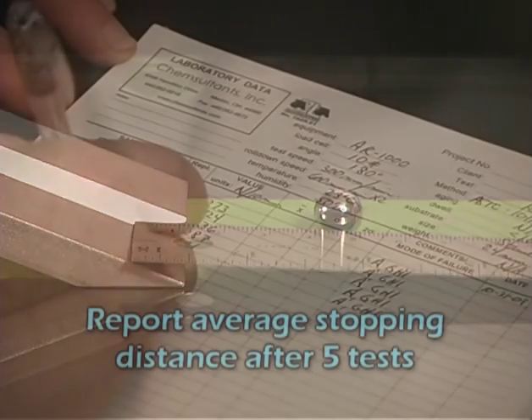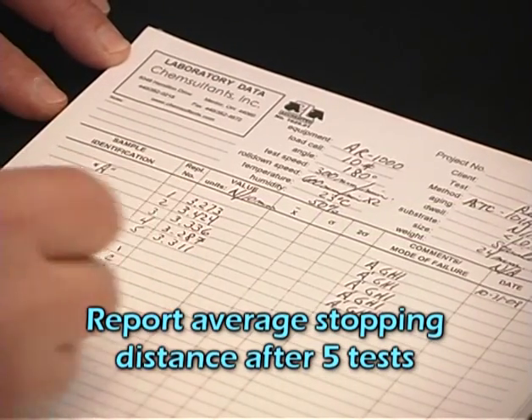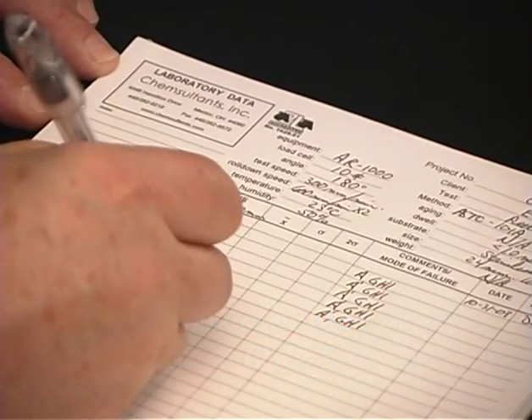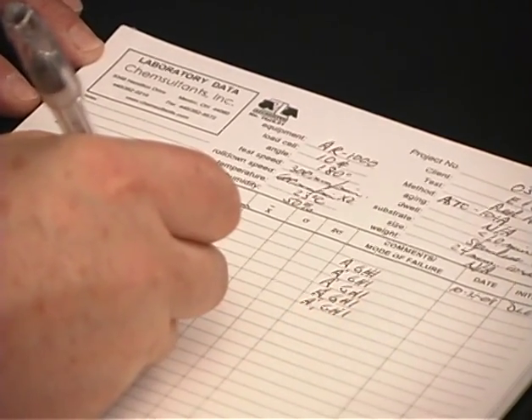Report the average stopping distance after completing five tests using a fresh sample for each test. Remember to clean the ball between each test.